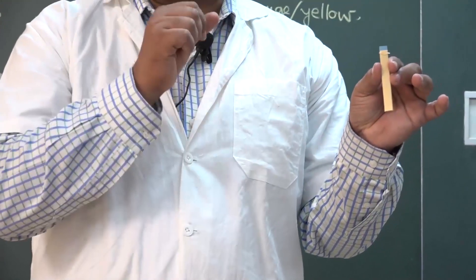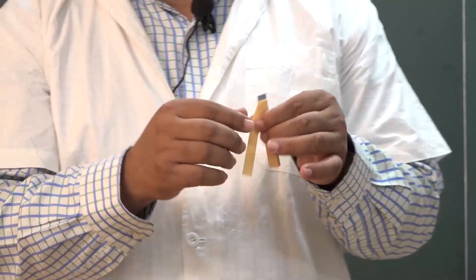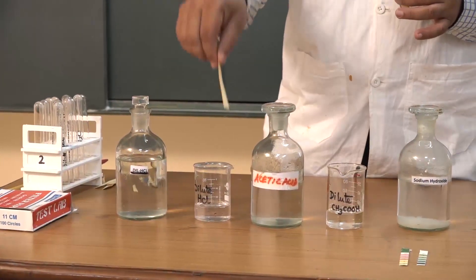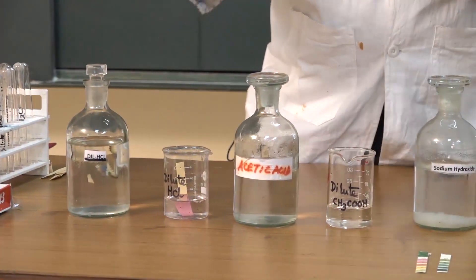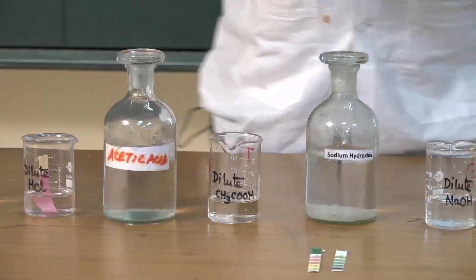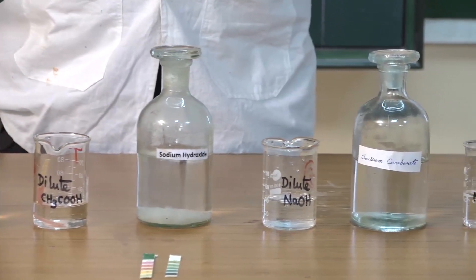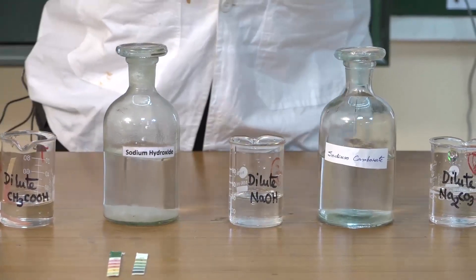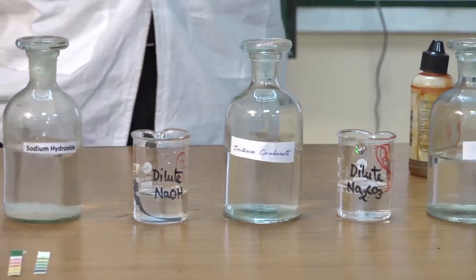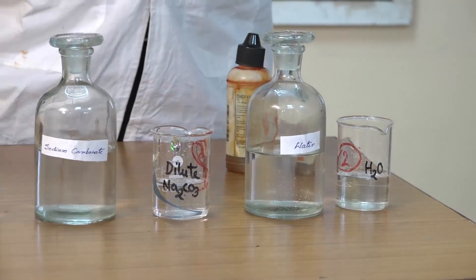In my hand you can see pH paper. Using the pH paper we will check the pH of the following solutions. First I am dipping the pH paper into the hydrochloric acid solution. Next I am dipping the pH paper into the acetic acid solution. Then into the sodium hydroxide solution, then sodium carbonate solution, and finally into water.